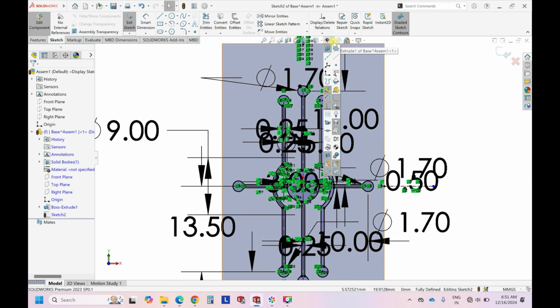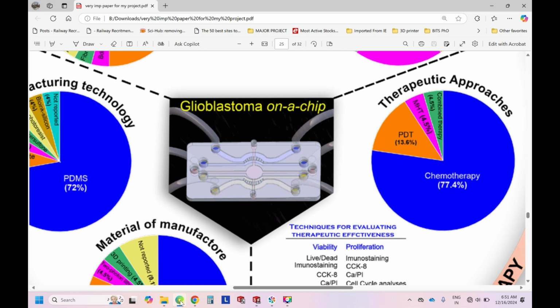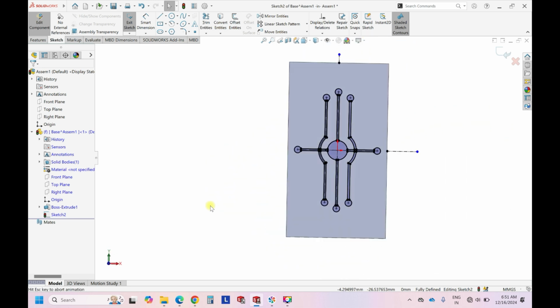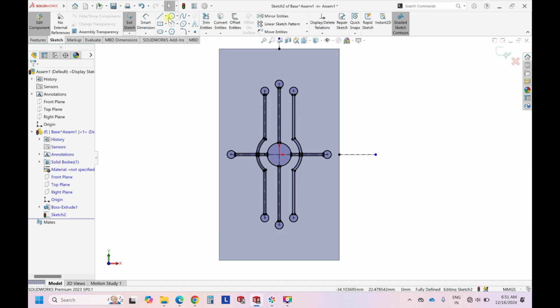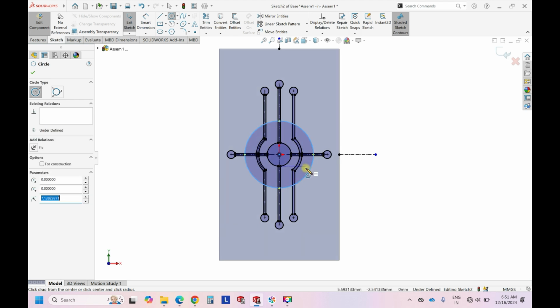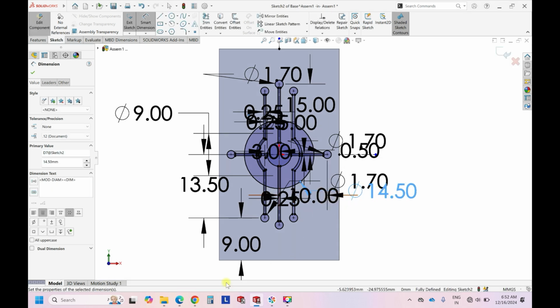So once it is done, for normal understanding, now this design is ready, right? So this is ready, and then we are left with the outer two channels. So in the same way we'll design for one and then we'll mirror it. Yeah. So again Control 8. So now we'll go for a bigger circle. We can have the dimension as it is 14, so we can go to 14.5, right? 14.5.